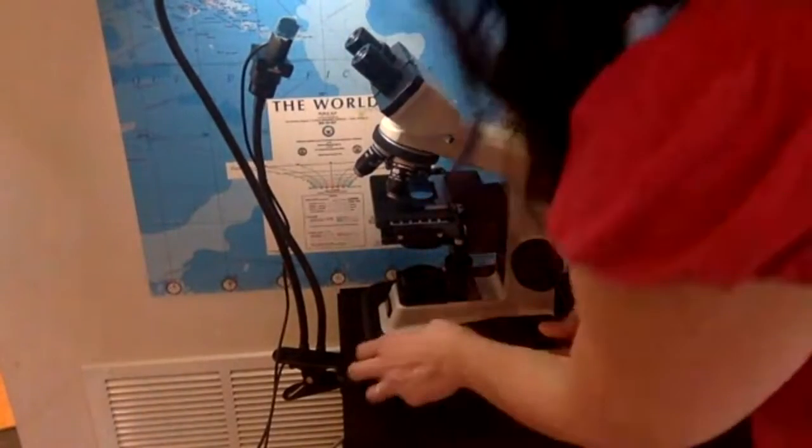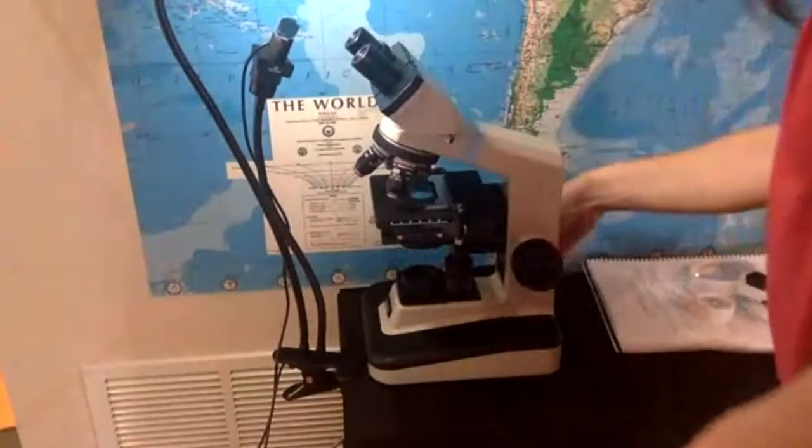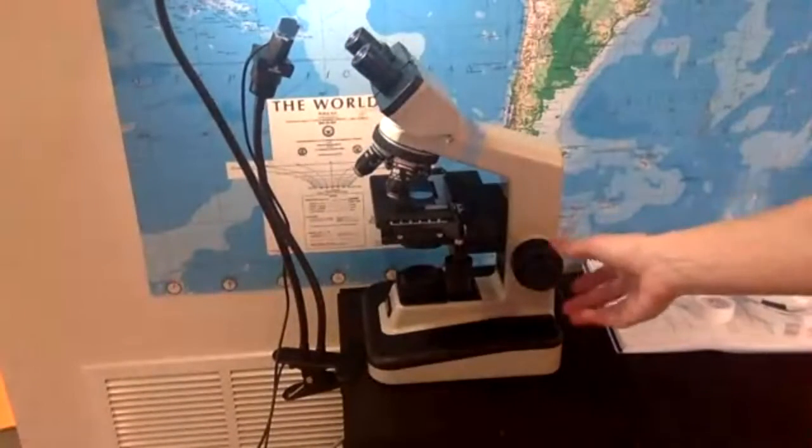I'm on the wrong side of the microscope, so I'm kind of lost. Hold on. Where are you? Okay. Pretend I turn the light on. When I go on the other side, it will go.